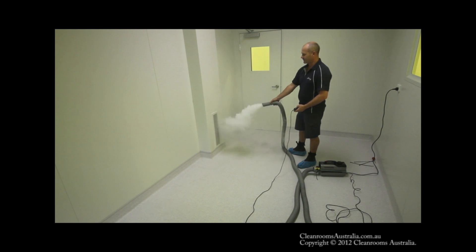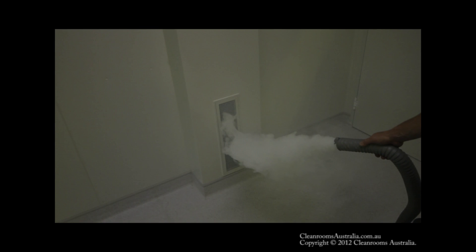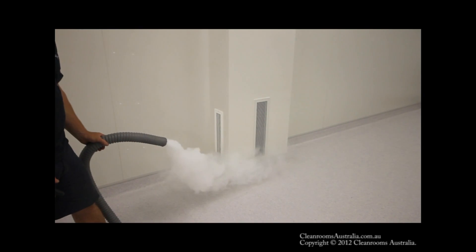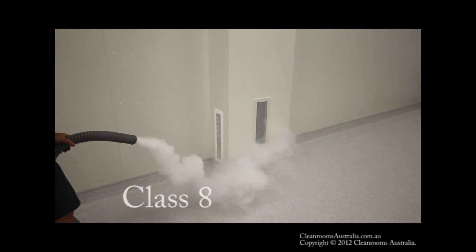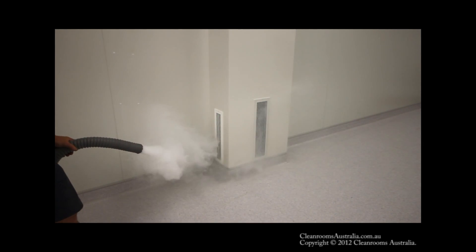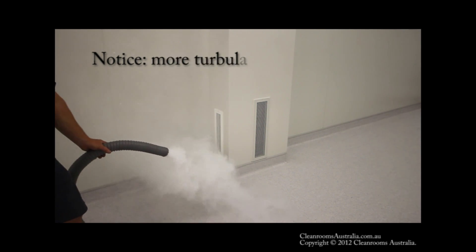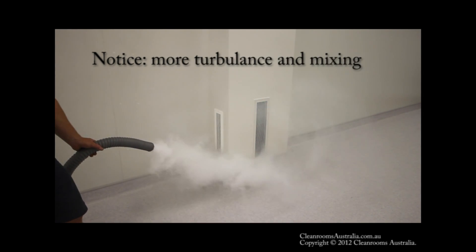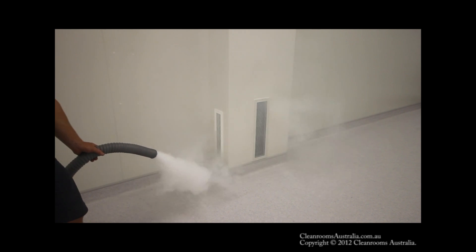As you're only going to be doing this on one or two occasions to prove your mixed flow or laminar flow, we take the opportunity at the commissioning stage while the technicians are still able to get into the clean room without gowning, as the smoke is likely to contaminate the entire facility.